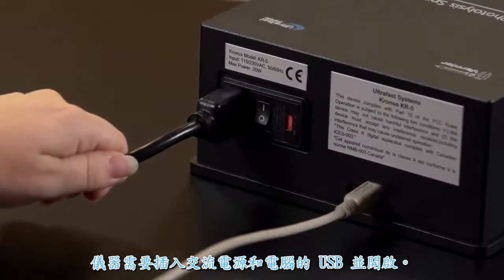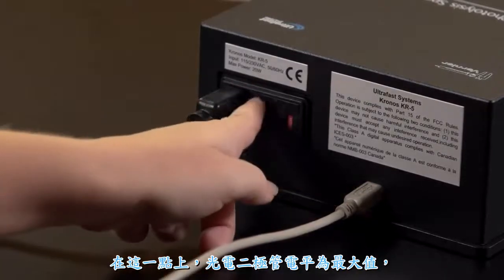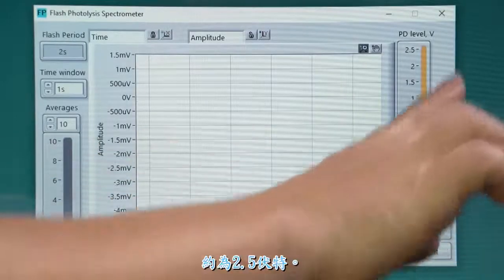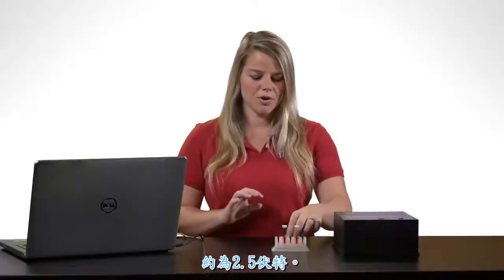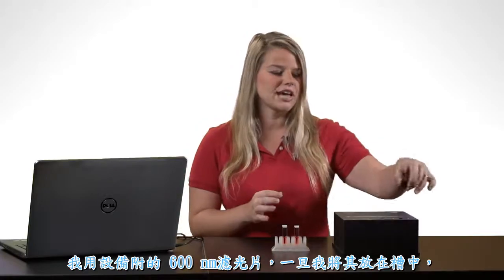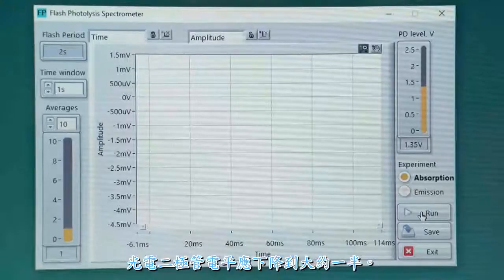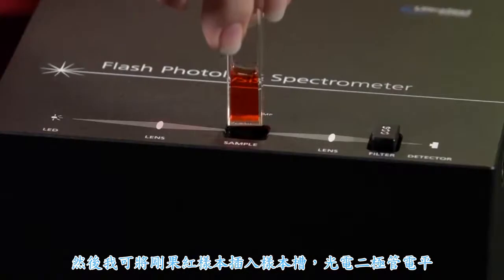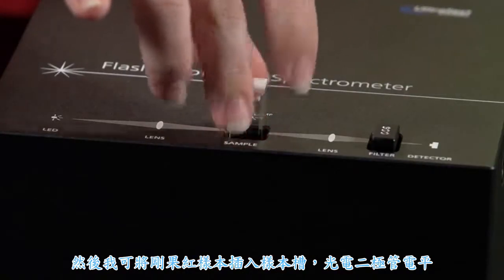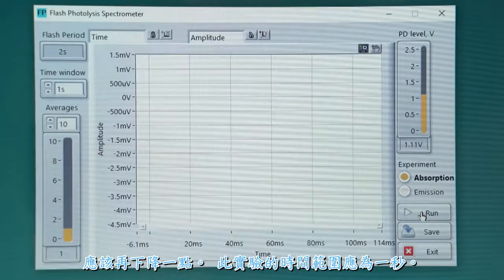The instrument needs to be plugged into AC power and into the USB of the computer and turned on. At this point, the photodiode level should be at max, about 2.5 volts. I'm going to be using the 600 nanometer filter that ships with the device, and once I set it in the filter slot, the photodiode level should drop to about half. I can then insert my Congo red sample into the sample cell, and the photodiode level should drop a little bit further.